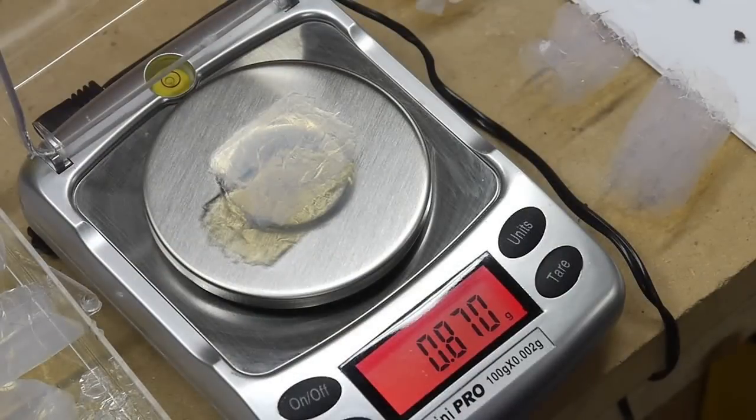But getting a lower density is definitely helpful. This piece has a density of about 100 milligrams per cubic centimeter, which is I think quite a bit better than the previous gels that I've made. But it still could be much lower.